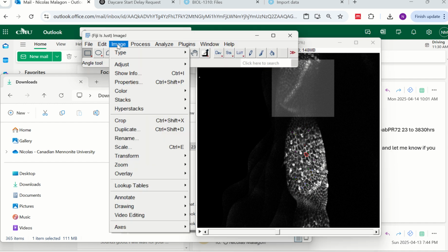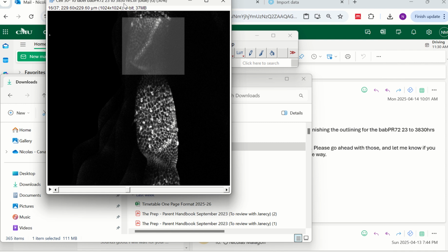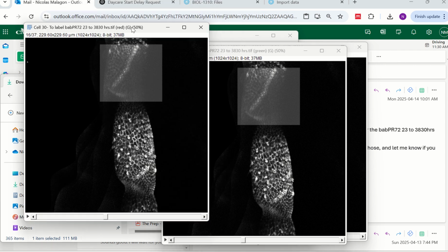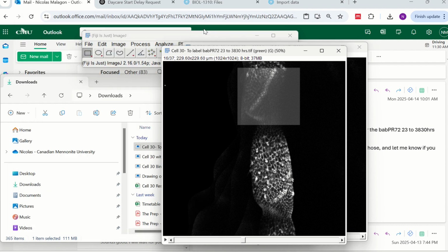So look what happened when we go, as we have done before, to color and split the channel, and we split it in R, G, B: red, green, and blue. Look, the blue one is not there. Good. Green is not there. But now the red one is here, but it doesn't look red. It looks like white. Before it would look green and white. Now you just see white and white. So we cannot separate it in that way. We have to do it in a different way.